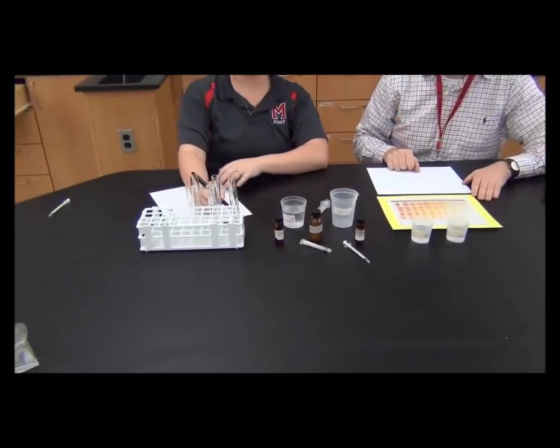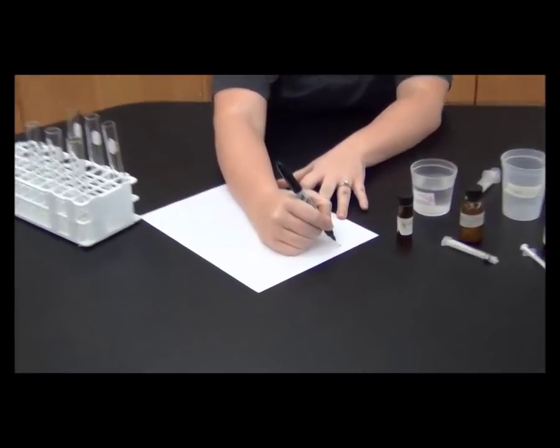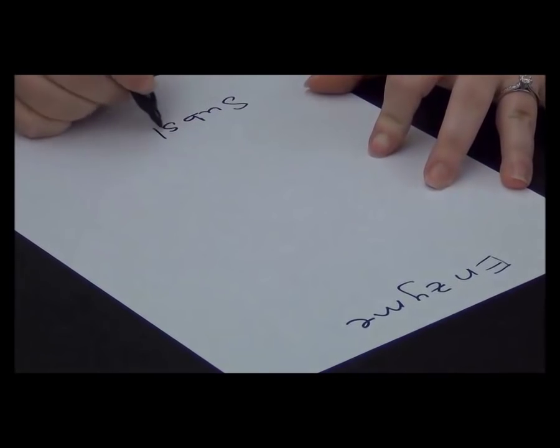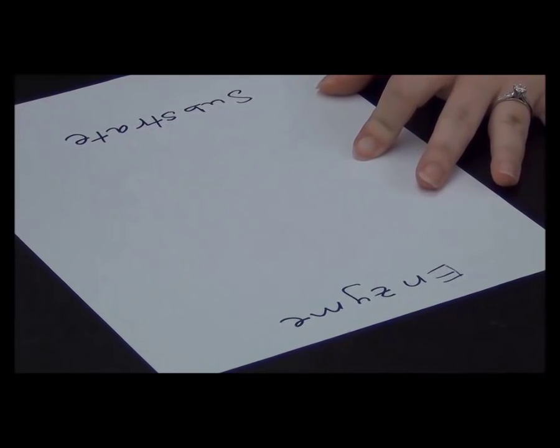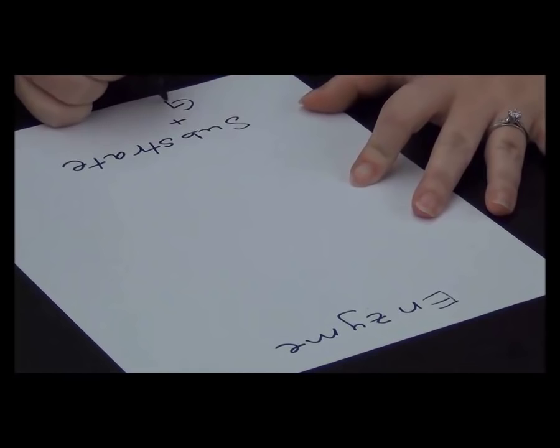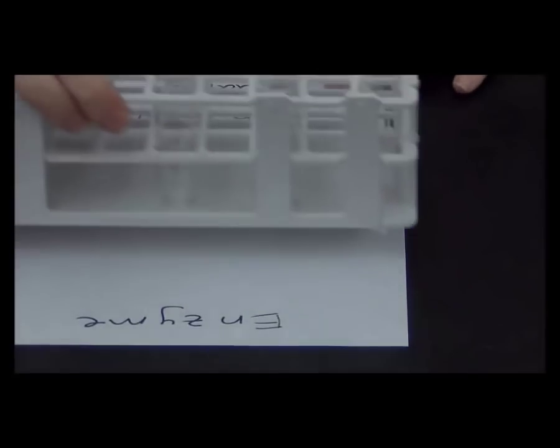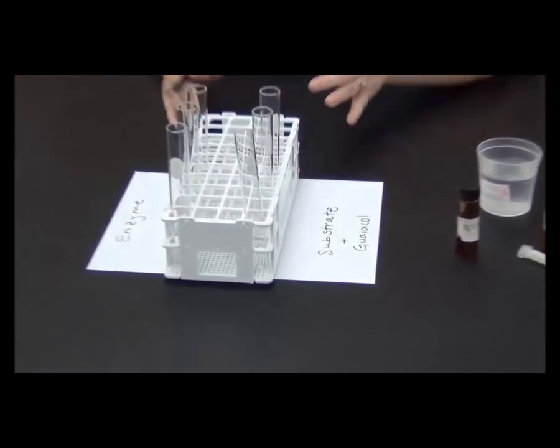The first thing you can do to make sure you do well in this lab is to label a piece of paper around your test tube rack. You'll want to add enzyme and water to one set of test tubes, and the substrate, guaiacol, and water to the other set, so that you don't mix them until you're ready to start your timer. Labeling everything this way ensures you add the right things to the right test tubes.